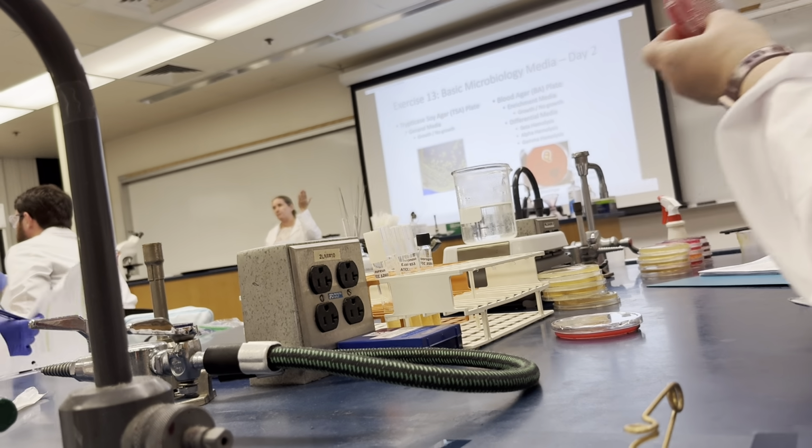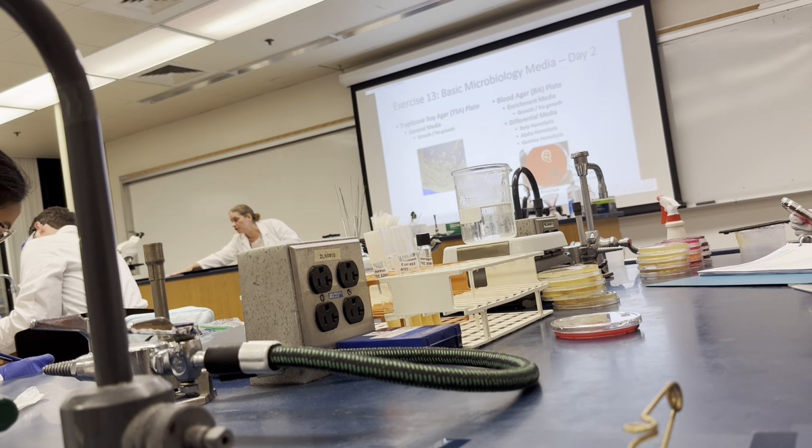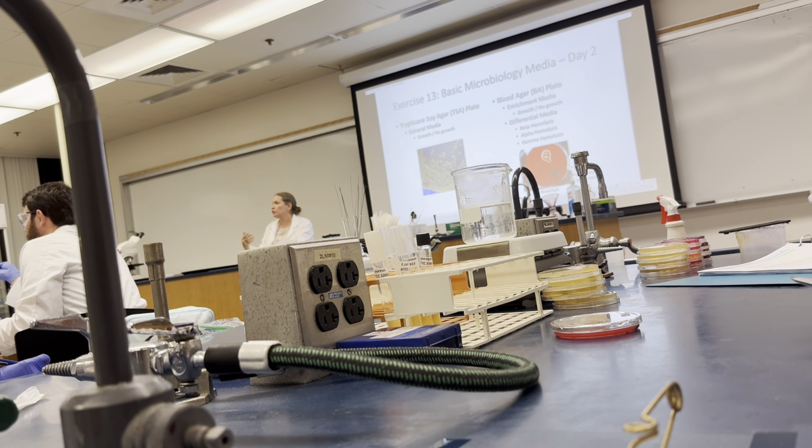You can hold it up to the light. I have held it up to, say, the edge of the table, where you can see the edge of the table in the background, right? When you're taking a picture. Okay, but you can see through the plate.